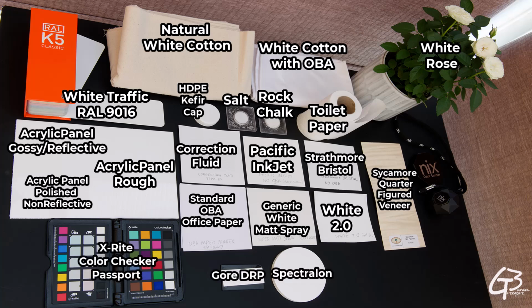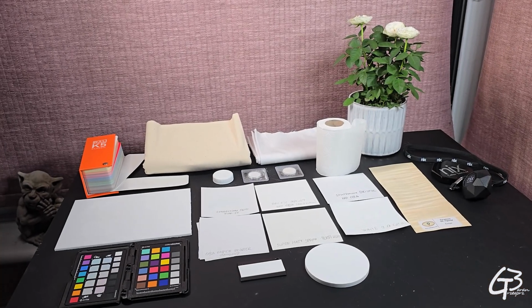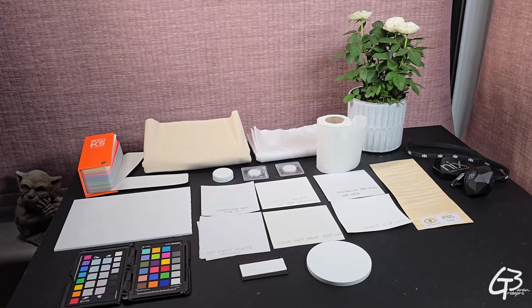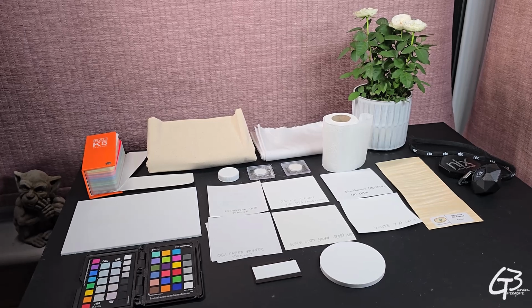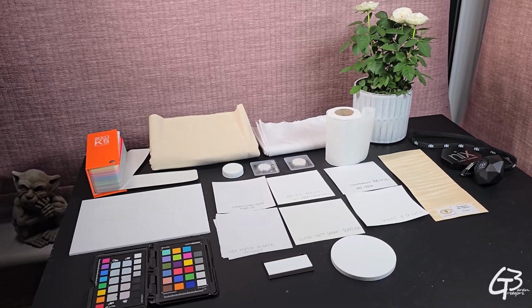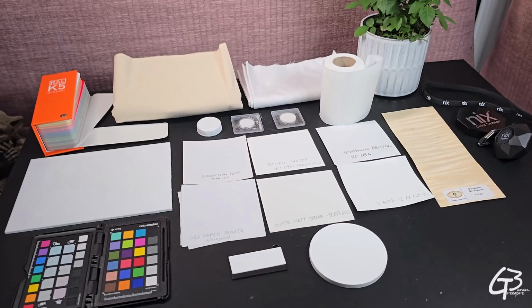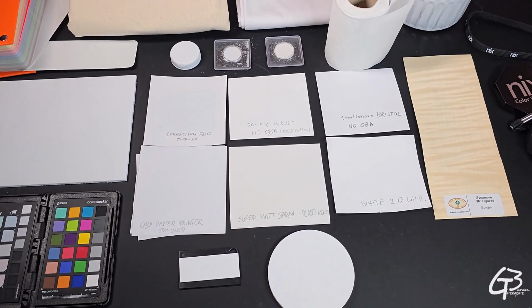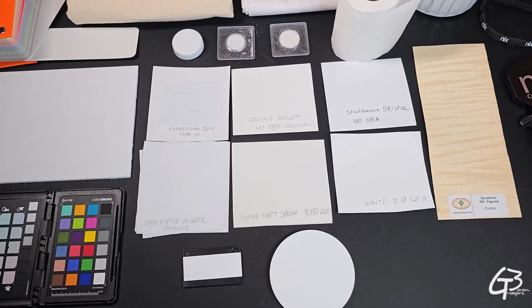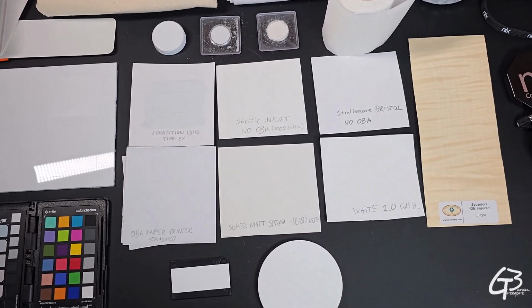the Gore DRP. But before we get into measurement results, let's illuminate them with the ultraviolet light to find out how much optical brightening agent was used for each to make them whiter. And as we already know, use of OBA makes color look slightly different under different light, depending on its composition and brightening agent age, as brightening agent decays when exposed to the light, decolorizing the substance it was applied to.